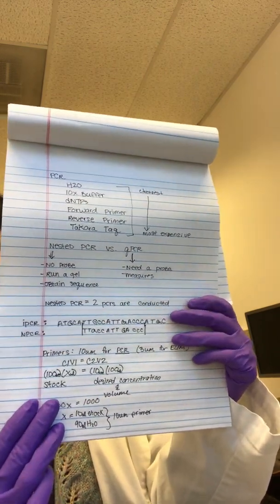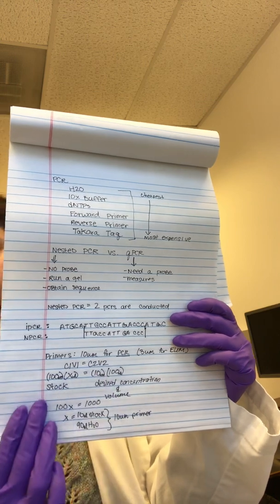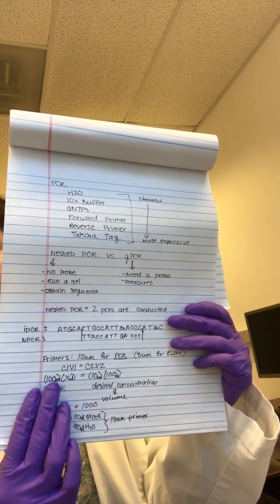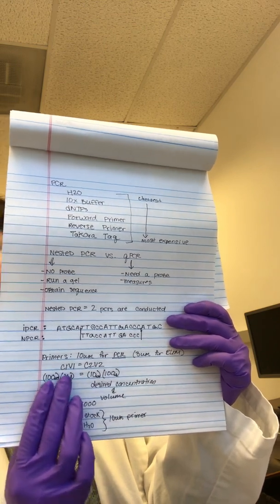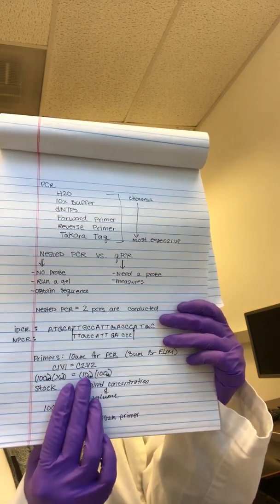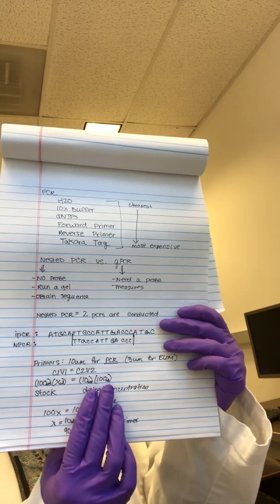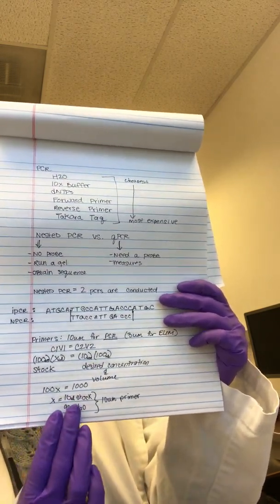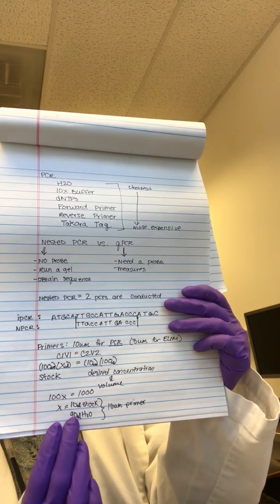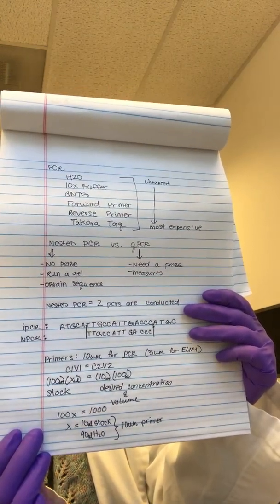In order to make a new primer, to dilute something down, you use the C1V1 equals C2V2 equation. So here on this side for C1V1, I wrote my stock, which is 100 micromolar. That should be written on the stock too. This is diluted down from the dried primer when you initially get it from IDT. X, because we're not really sure how many microliters of the stock we need for our desired concentration. Our desired concentration is 10 micromolar. I like to make my volume 100 microliters, just because I need more than this, and you're going through too many freeze-thaw cycles on your primers. Solve for X, and you get 10. So you want 10 microliters of your stock and 90 microliters of H2O. This is just 100 minus 10. So perfect. That will give you the desired primers, and that's everything you need in order to start your PCR.